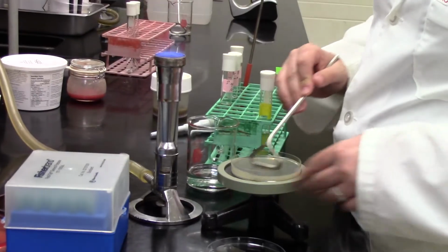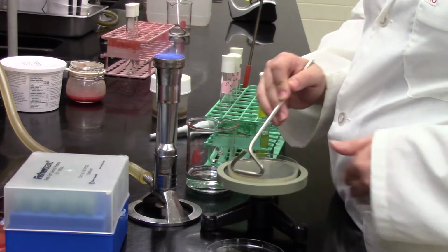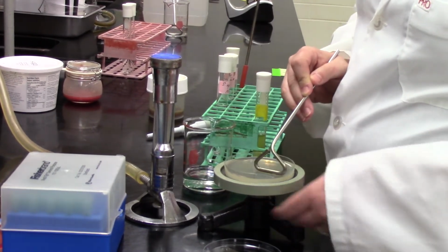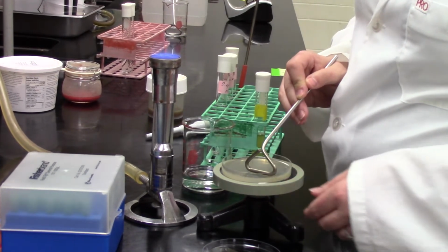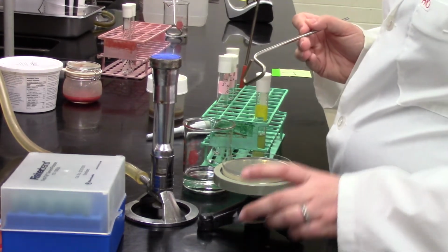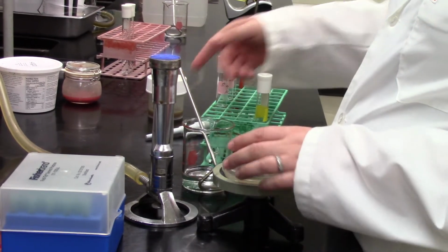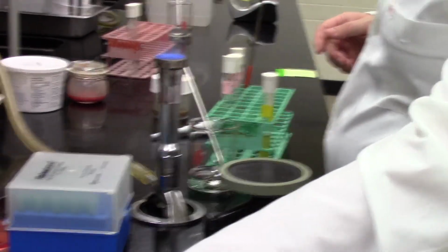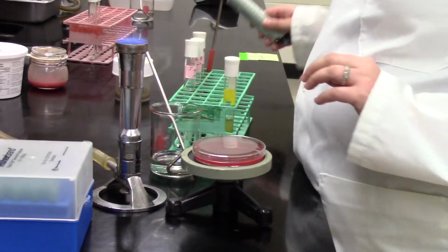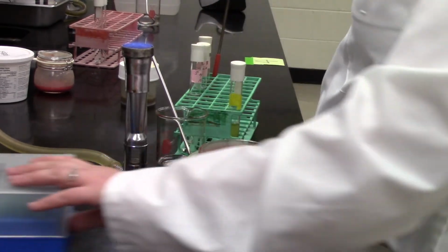So there, we got the plate going around and round. The spreader goes back and forth for the spread plate. And then at the very end, you can go around the outside, and it should be good. We'll have to see what happens when we incubate this mix of juices from the parsley that's, like I said, purely for lab purposes. I left it way too long in the fridge.